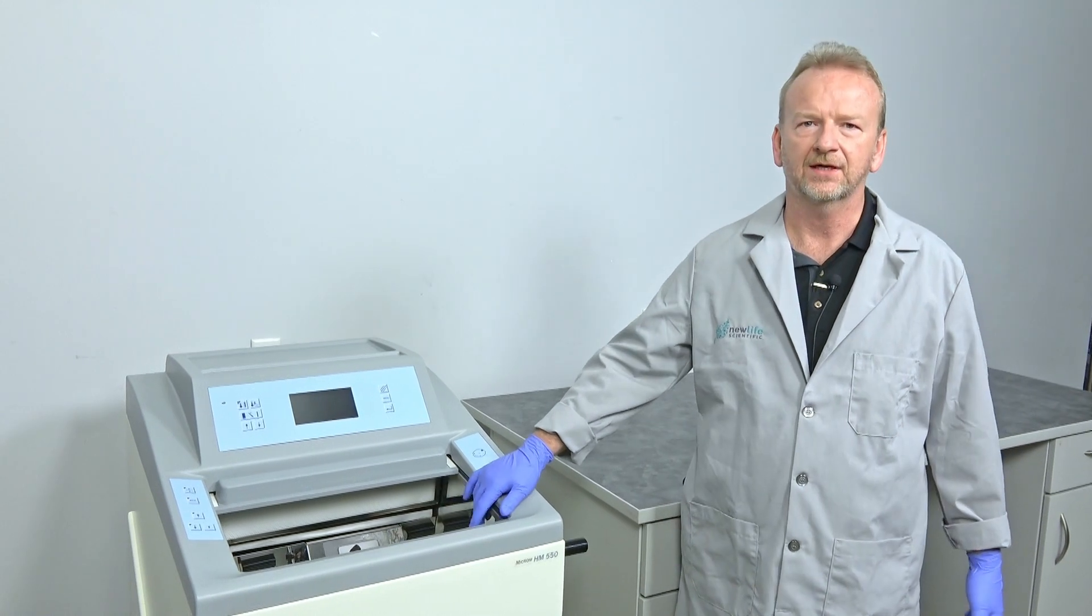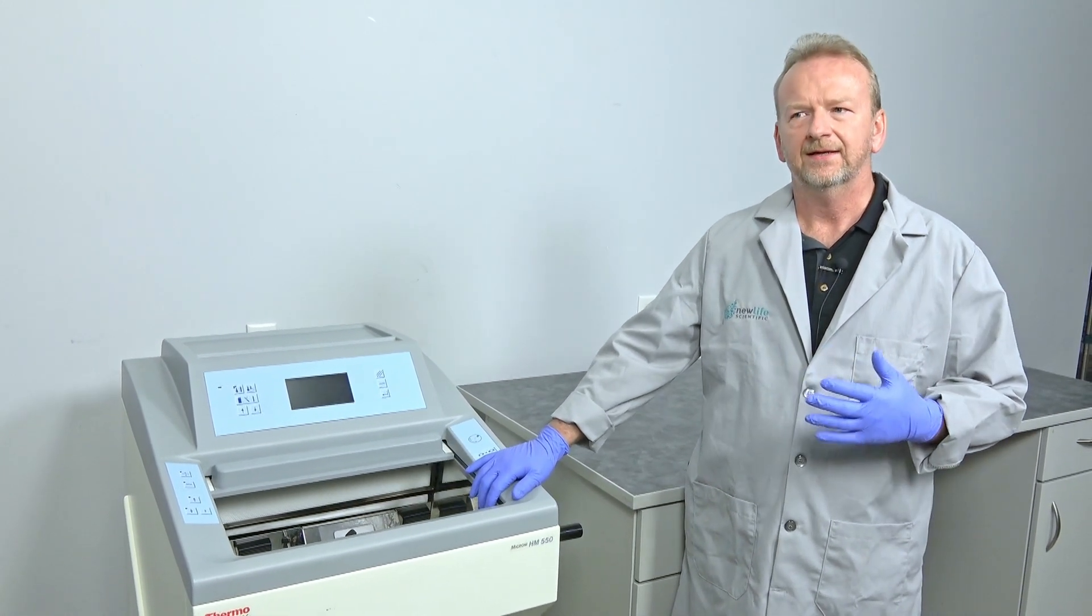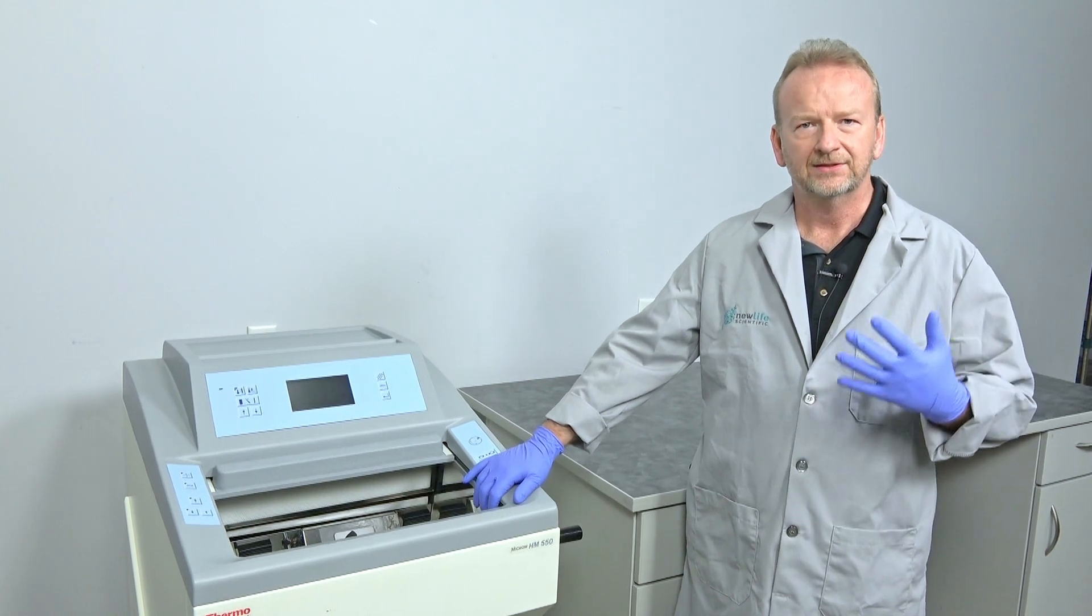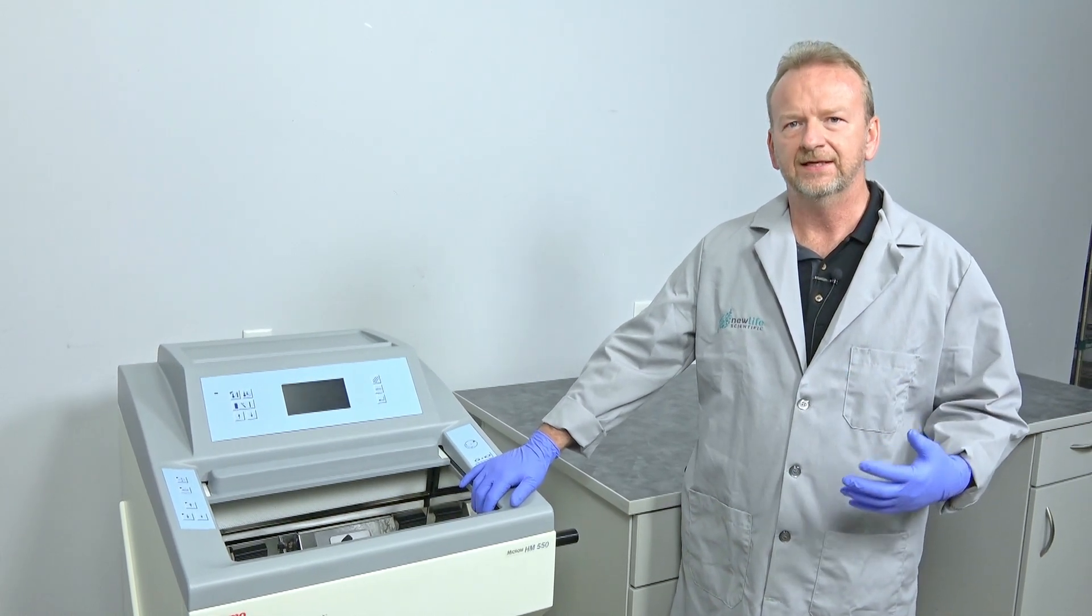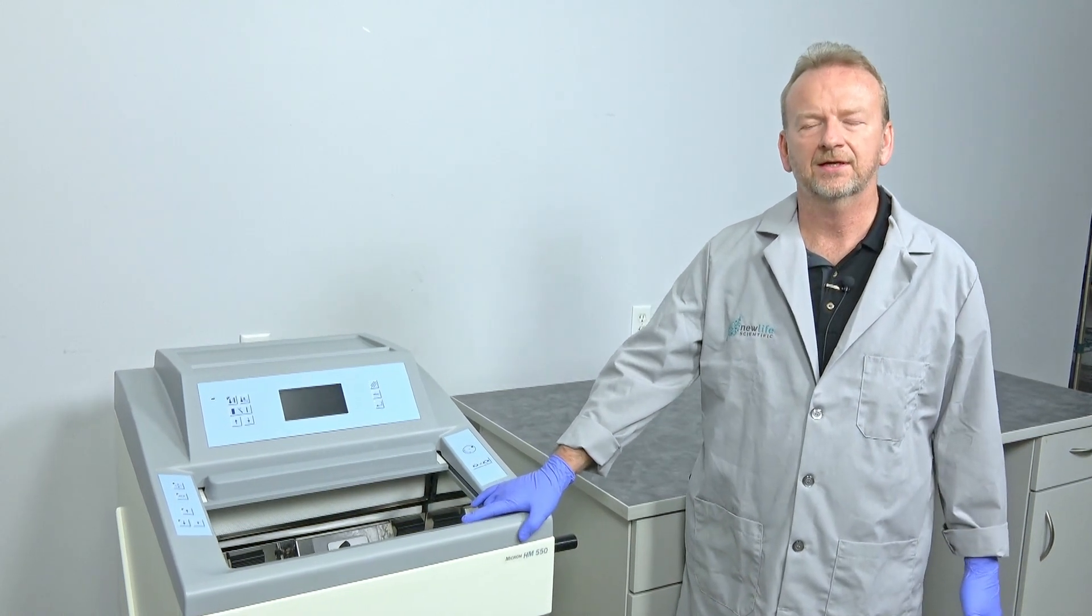I'll take it over here, disassemble it, clean it, dry it off, and then put it back together and make the adjustments that you need to make your cuts.